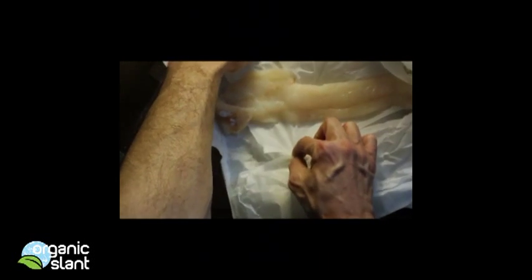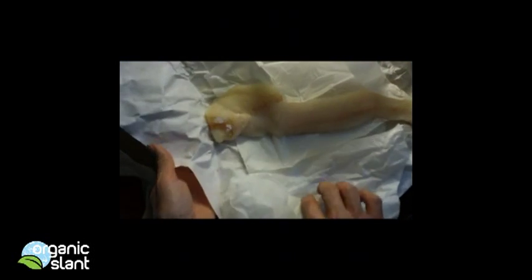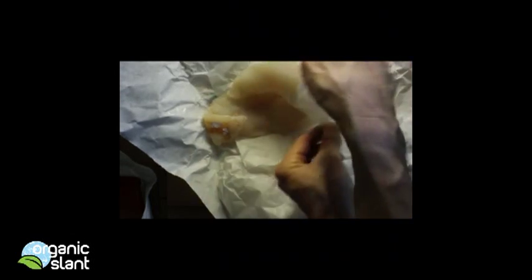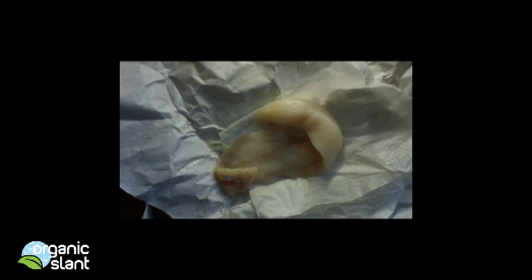Now let's pull out the cod. Alaskan cod. Let's fold this over so the pieces are concentrated. Put it over so we can see it. Alright, here we go.